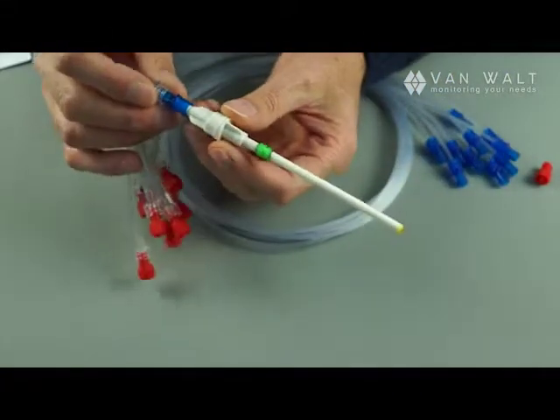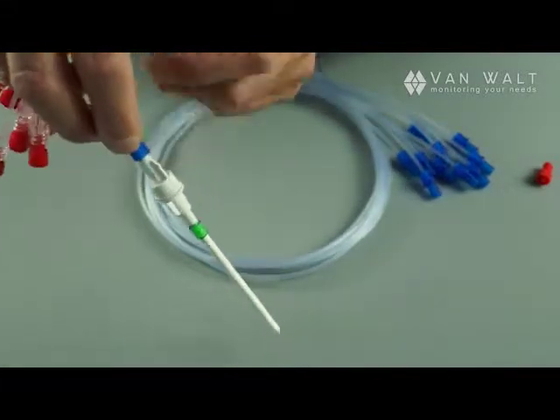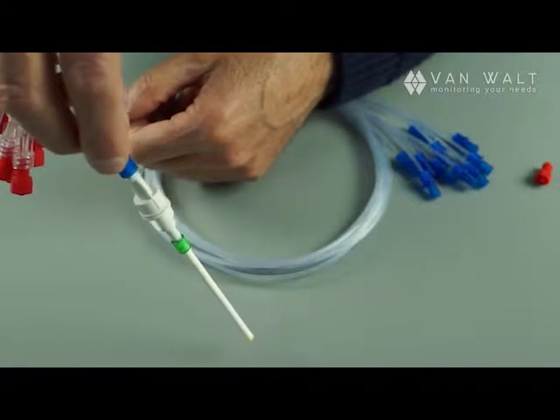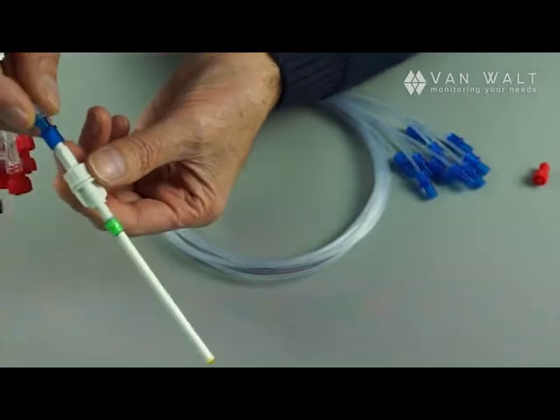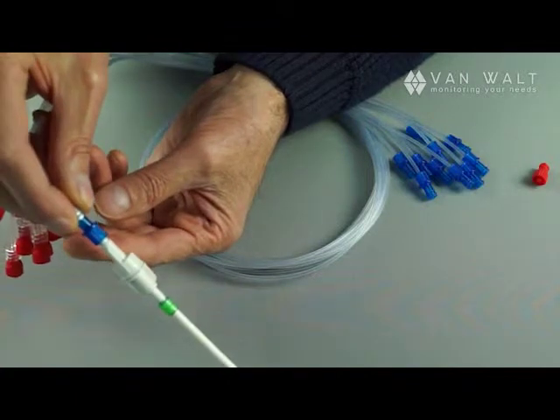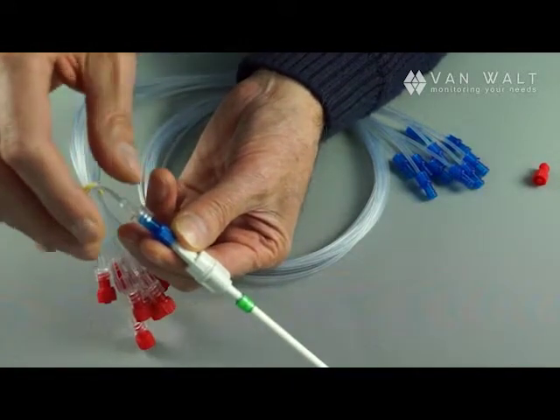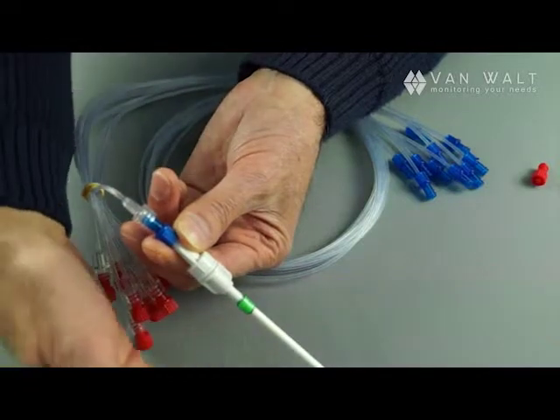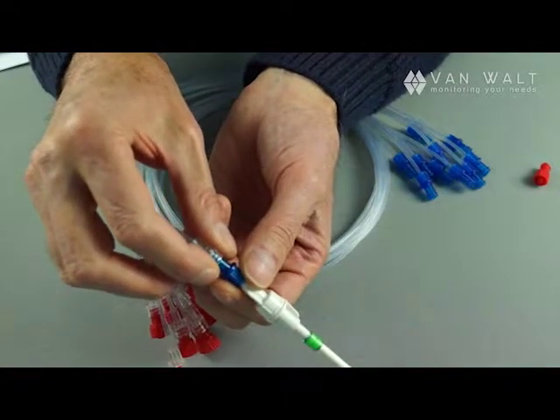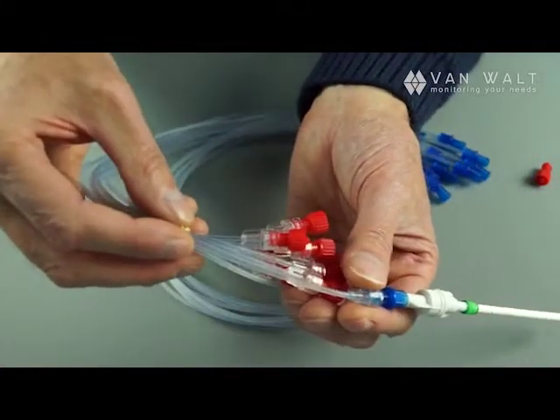Insertion of these is relatively straightforward. We would never suggest that you insert these vertically into the soil because water will trickle down the sides and will have an influence on the sample which you collect. We normally would recommend that you insert these at an angle of maybe 45 degrees. A hole is drilled at that angle into the soil, and with an insertion tool which has a spike, you can pre-spike into the soil so that you can insert this gently into the sediment.